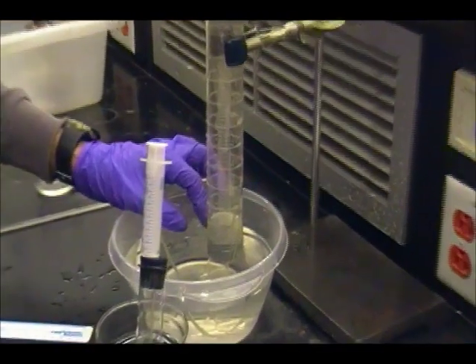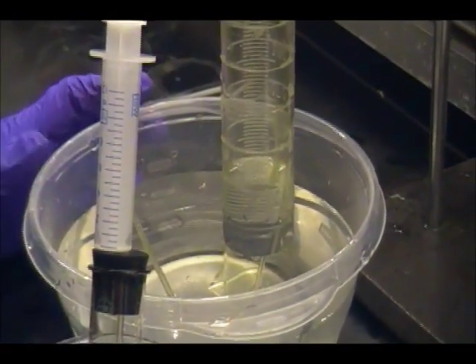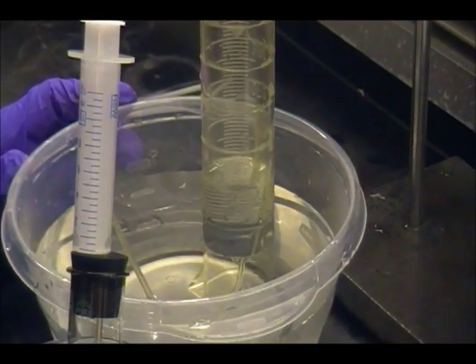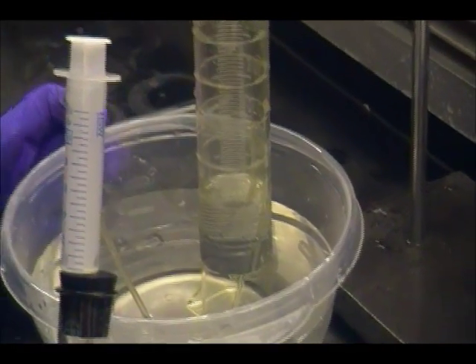If the water level of the graduated cylinder is depressed below the water level of the container, that means the hydrogen gas's pressure is greater than the barometric pressure, and in that case you'll need to add the measured difference that you got from the ruler to the barometric pressure once you have converted the centimeters into torr.